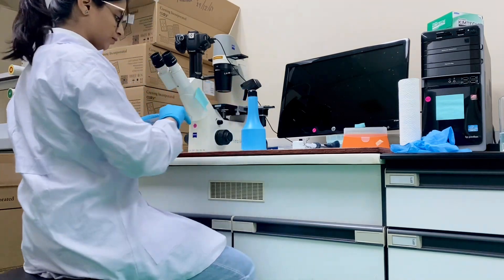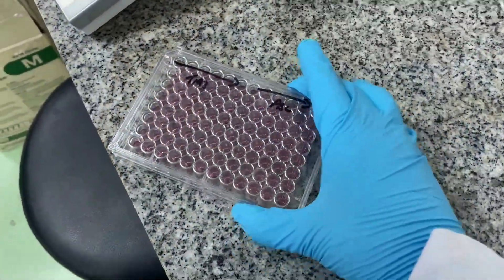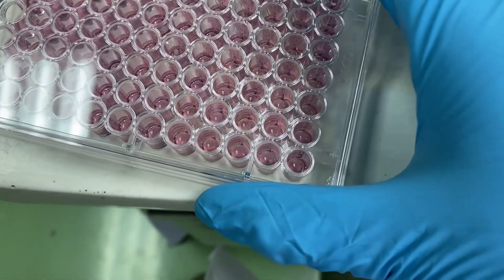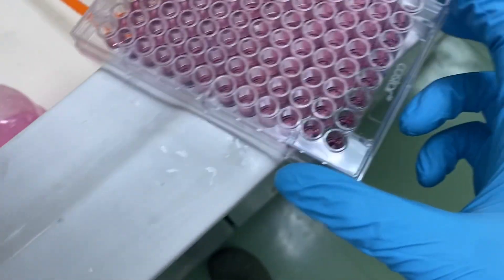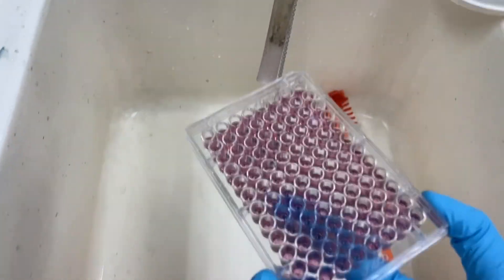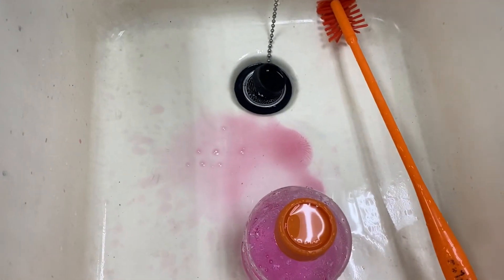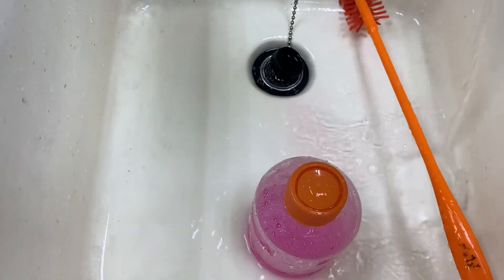The process is pretty simple: you just have to throw out the solution already in the plate, then dissolve the crystals using DMSO. I'm removing the lid of the plate and giving the plate a big jerk, which removes all the solution. If you're not sure, you can do it again — but make sure to run water over the solution, otherwise it will leave a lot of stains on your sink because it contains MTT.